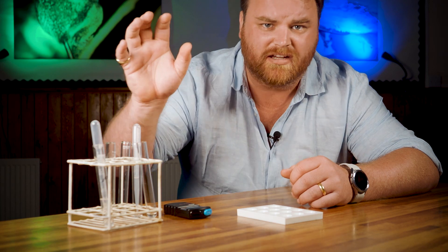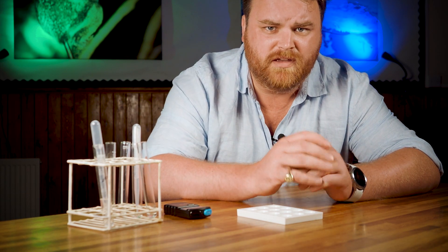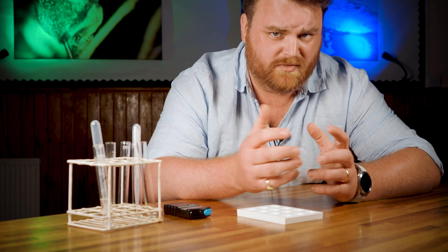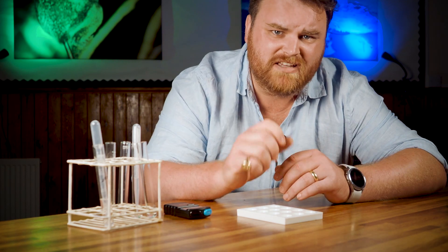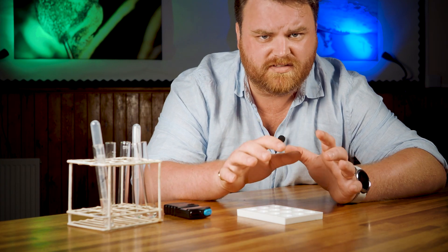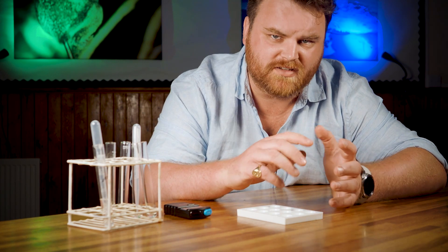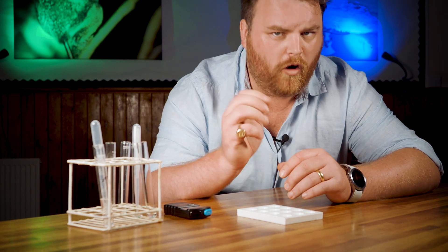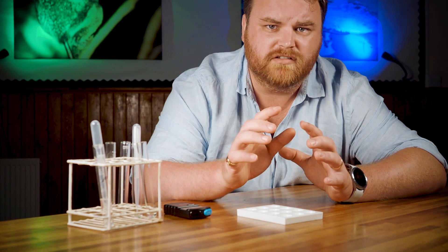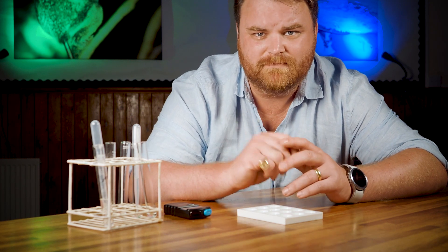Every 10 seconds, I take a drop of the reaction mixture and place it onto the iodine to test for starch. At first, the mixture is testing positive for starch, which means the reaction hasn't finished yet. Eventually, the iodine will stop changing colour, and that means all of the starch has been digested. So the faster this happens, the faster the rate of reaction. We then do the whole thing again using different buffers to manipulate the pH to find out what the optimum pH is for, in this case, amylase.